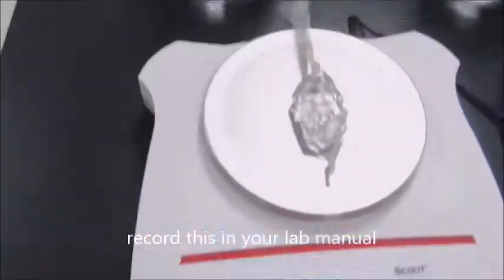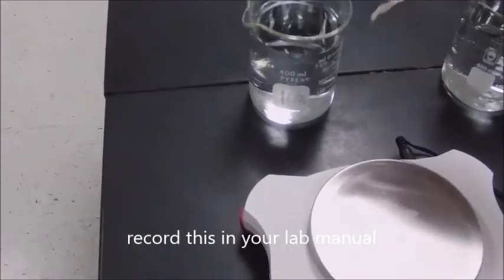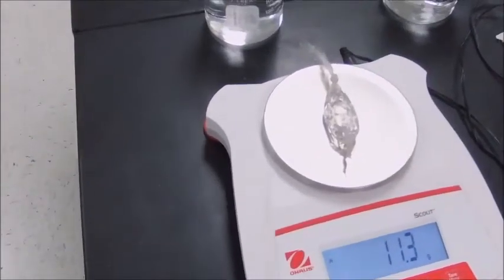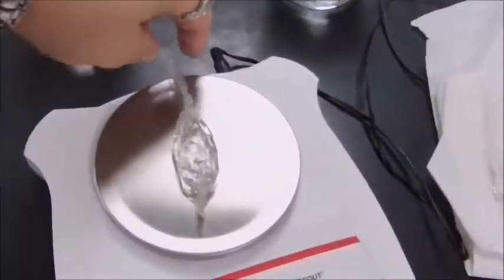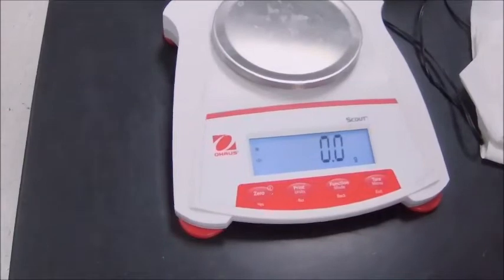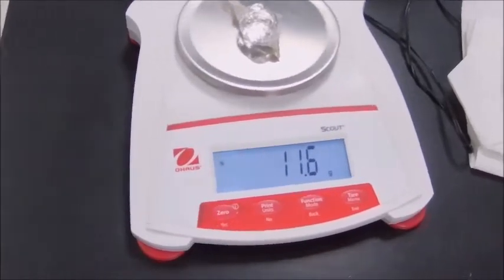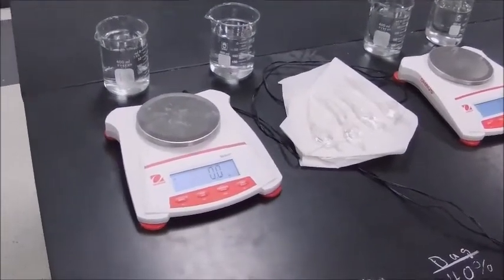The initial weights are as follows: the first water bag is 11.1 grams going into a beaker of water; the next is 11.3 grams; the 40% sucrose bag is 12.1 grams; and the last is 11.6 grams. These bags will now be placed into their associated beakers.